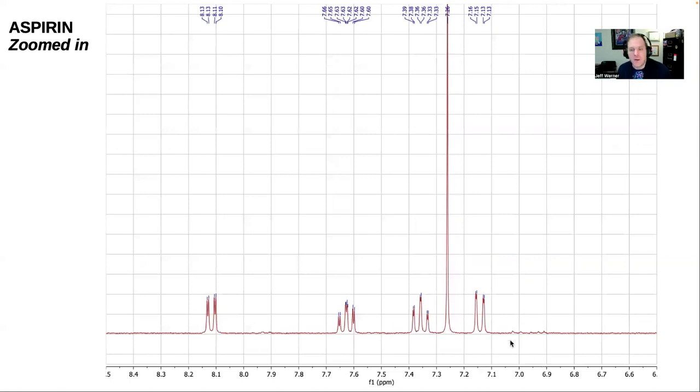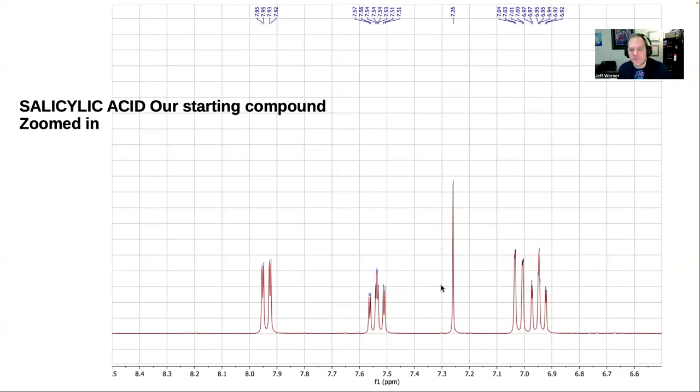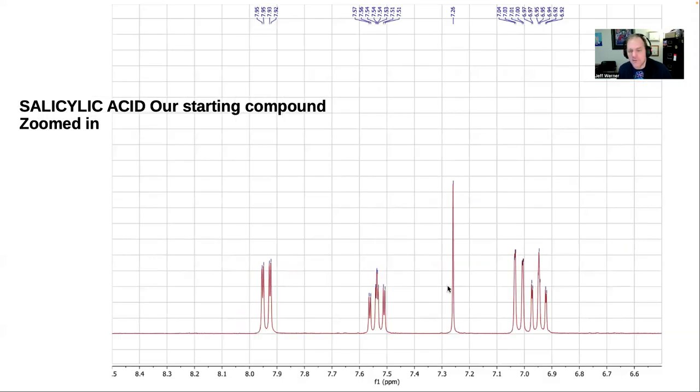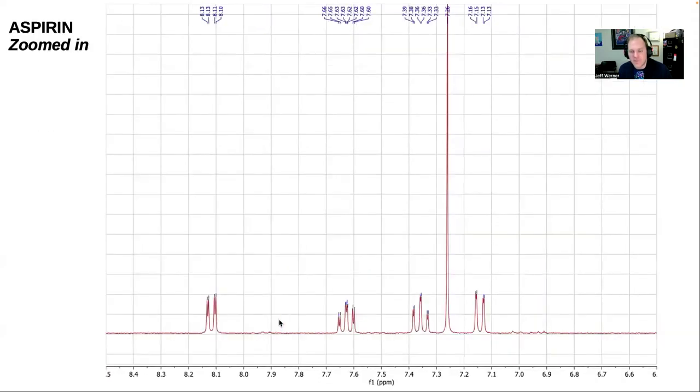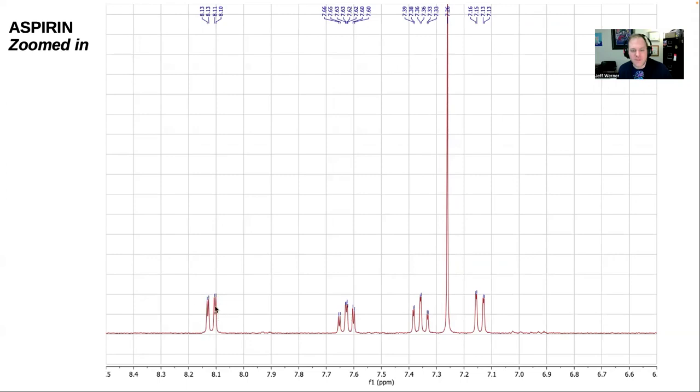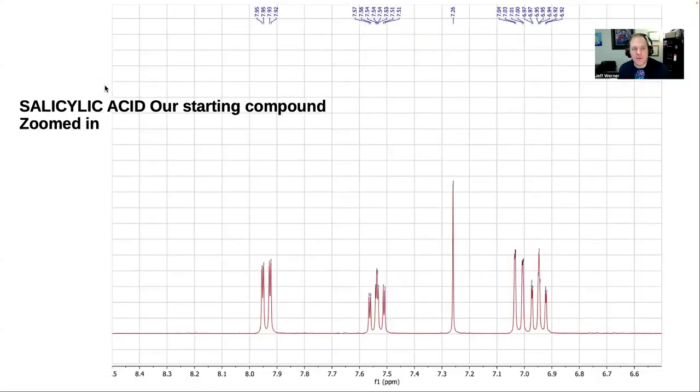Aspirin, salicylic acid, aspirin, salicylic acid. They're different, right? One thing I'm seeing right away is that aspirin has 3 clusters to the left of this 7.25 peak, while salicylic acid has 2 clusters to the left of the 7.25 peak, and they're in different positions. If you see this doublet for this cluster here to the left of 8.1, that only happens in aspirin. Sorry, jumping around. In salicylic acid, there's nothing to the left of 8.1. The doublet is over here to the left of 7.9. That change in position helps us to identify the difference between them.